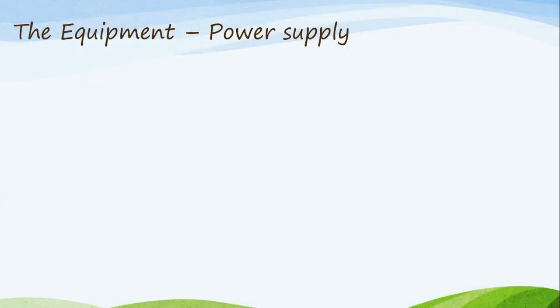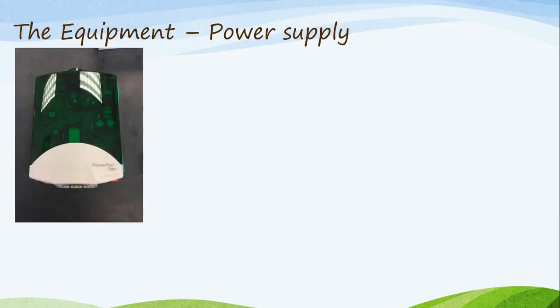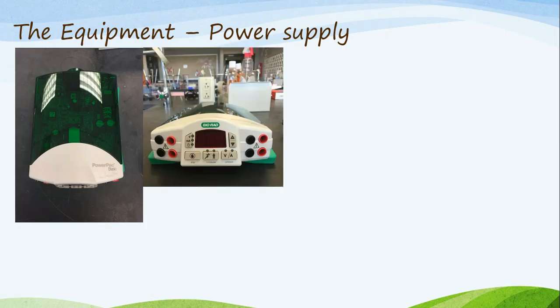So you're going to be doing a gel electrophoresis in Principles of Biomedical Science. You might as well familiarize yourself with some of the equipment. Let's start with the power supply. The power supply looks exactly like this, and it even has the word power written on it. If you need another angle to view the power supply, try the forward view. These power supplies are provided by Biorad, and they've kind of made them dummy proof.